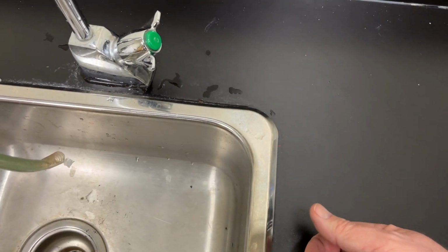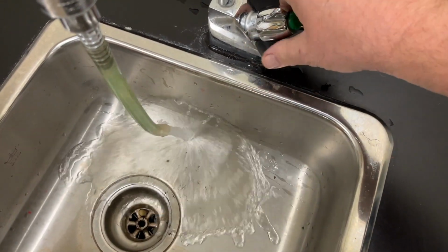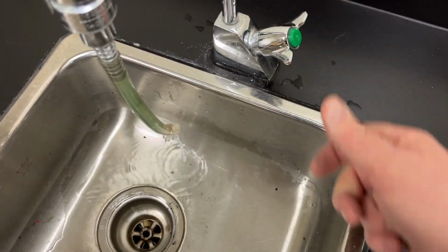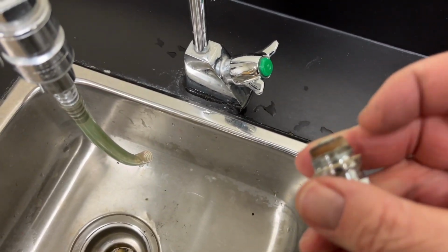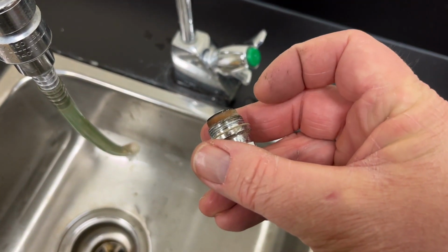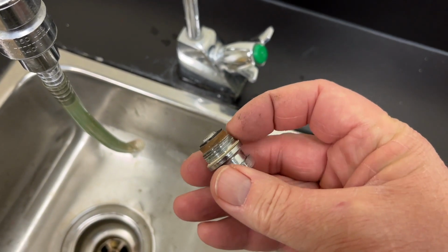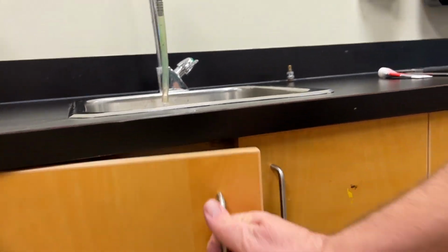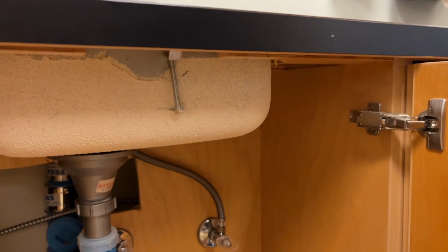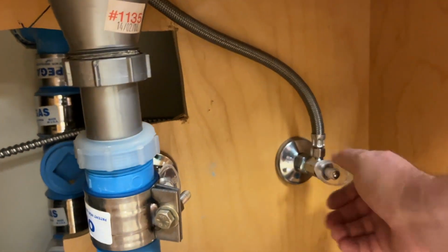I don't think there's anything wrong with the cartridge. I say that because this isn't dripping, and it works fine. So the cartridge is probably fine. We're probably just talking about needing to reseal around here. And like with any other plumbing job, let's start by shutting off the water.